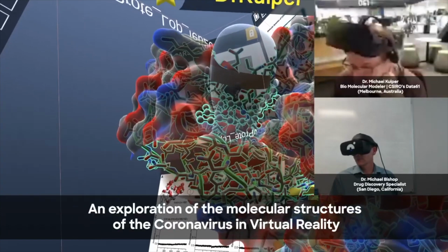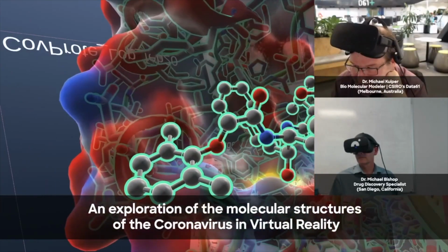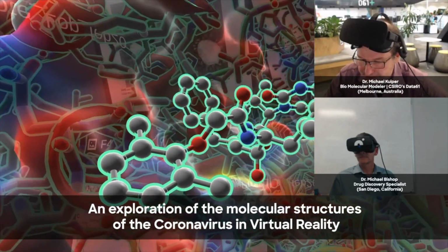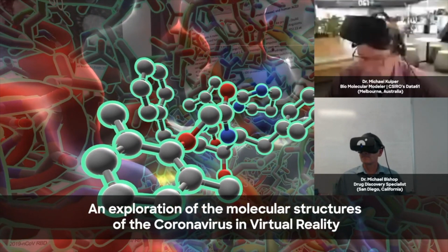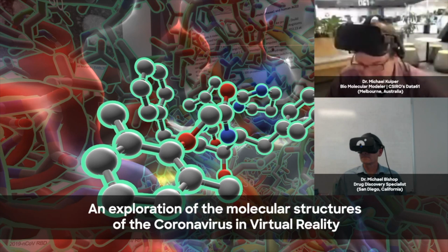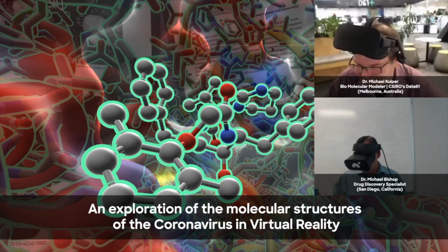Funny enough, I actually use this pretty much every day now. I just find using virtual reality to look at the structures such a valuable addition to my work. I find it really compelling. In fact, I'll tell the story. I was a bit of a skeptic of VR originally. About a year ago, someone told me, you should get VR to look at your molecules. And I said, why would I do that? I can just do it on my screen, it's fine.